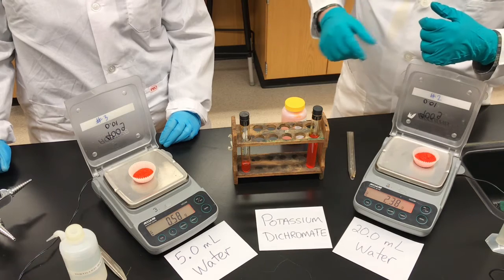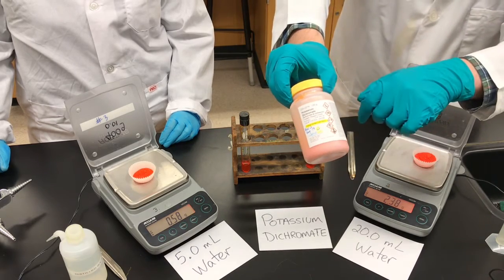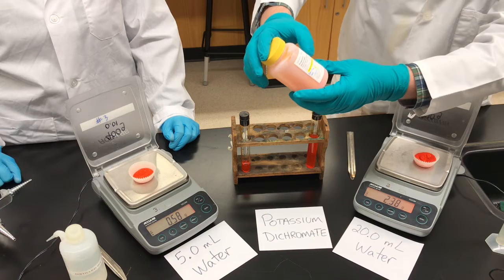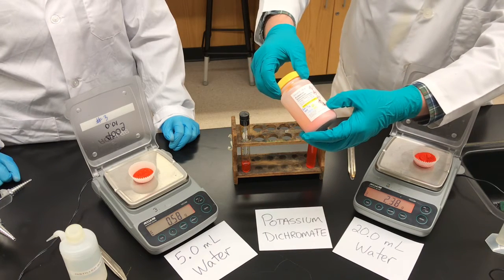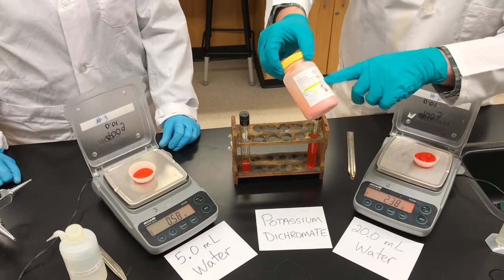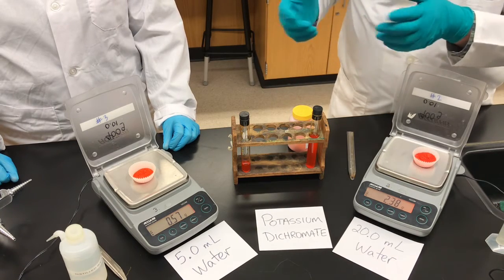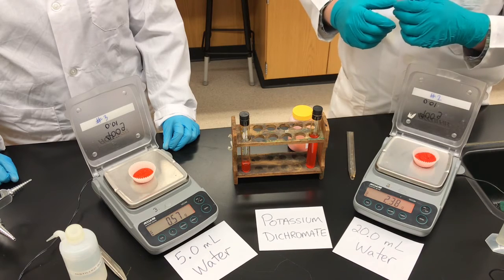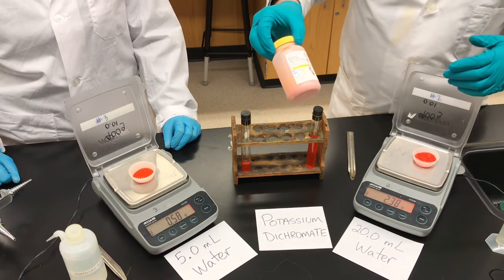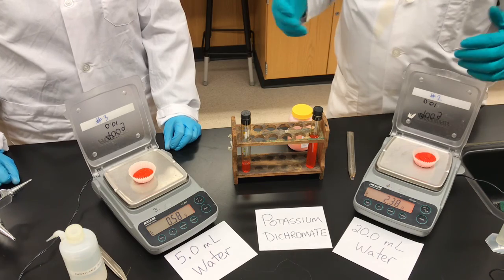We're going to have a better technique in another lab. A quick point about the solute we used: potassium dichromate, as you can see from its safety label, has a lot of GHS pictograms — it's toxic, corrosive, and an oxidizer that should only be handled carefully because of health effects if you breathe it in. Luckily we're both wearing our coronavirus masks and gloves. It's also bad for the environment, so we're not going to pour these solutions down the drain — we'll collect them for environmentally friendly disposal at end of year. We use this salt because it gives a nice orange solution, but it is a toxic chemical. Hope that's a good introduction to the first lab in the solubility unit. Good luck and take care.